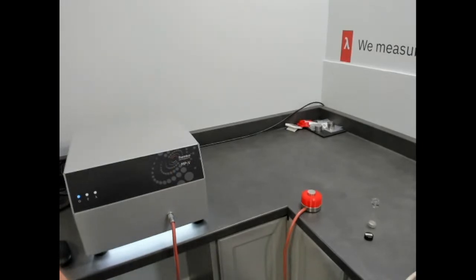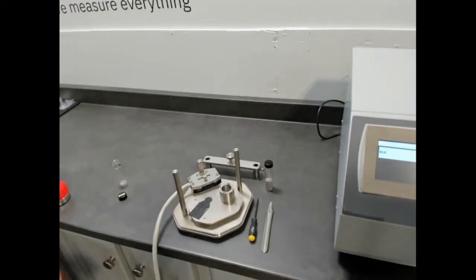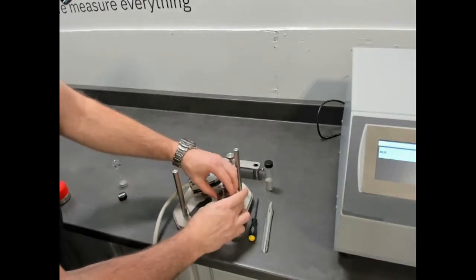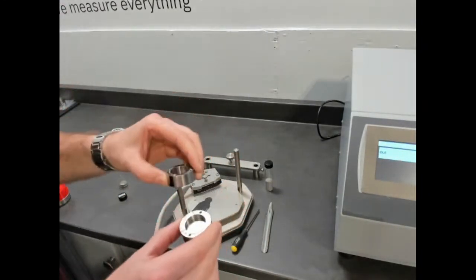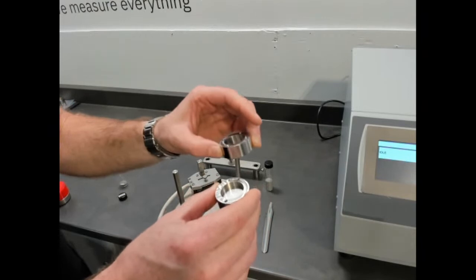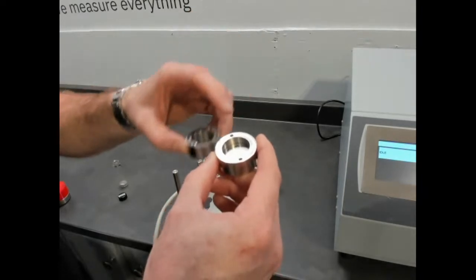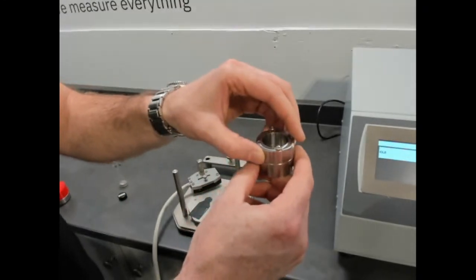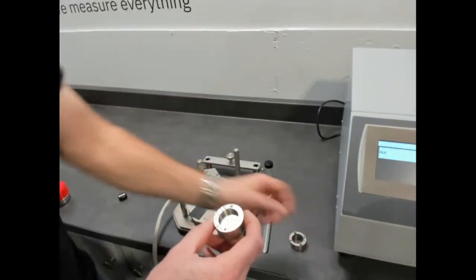So symmetrically, I'm going to point at this guy, and we'll show you the setup. This is the sample holder that's optional on your MTPS, whether it's on the MP1 or MP-V. It comes in parts, and it's dividable, if that's the right way to describe it. It has an opening on the bottom, a cutaway for the MTPS sensor, and then a top that you screw in place. And once it's in place, you pour the rest of your powder in. So we'll assemble it and show the basic setup.